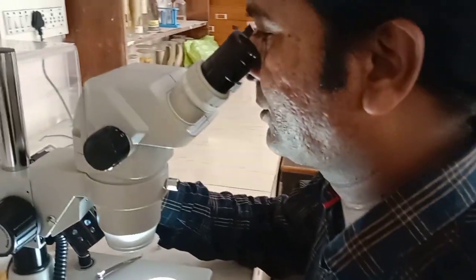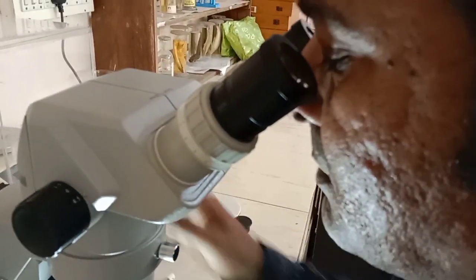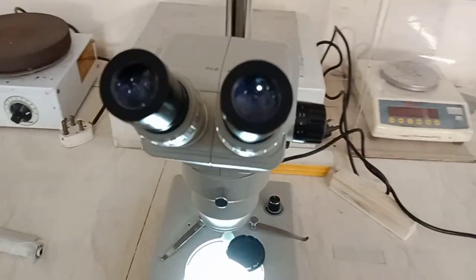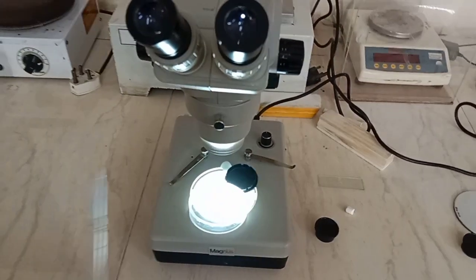I will just like to show you the soil nematodes under this microscope. Now we will observe the soil nematodes in this microscope. Now you can clearly see the soil nematodes under this stereo microscope. You can see the movement of these soil nematodes, which are directly being focused on this stereo microscope.